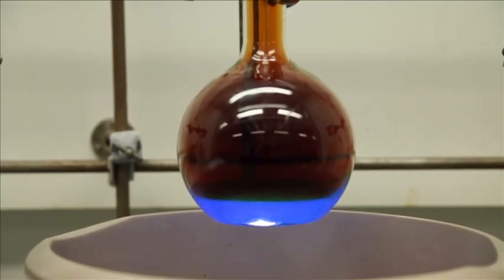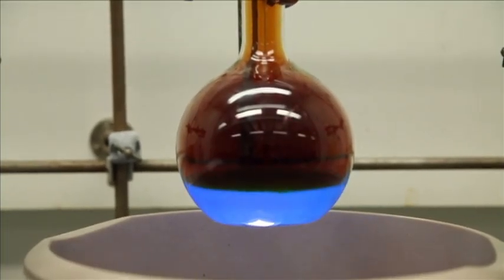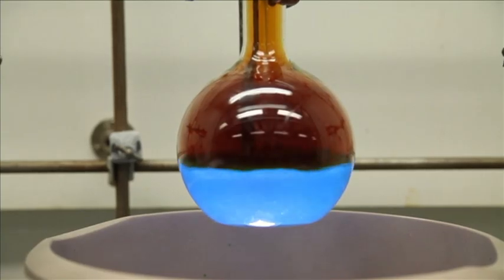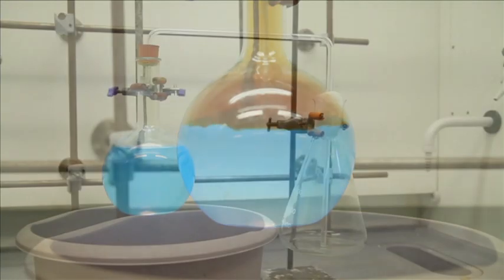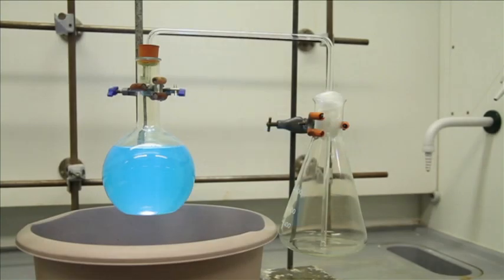When the water reaches the reaction flask, the NO2 dissolves in and reacts with the water, and the pressure drops still further, leading to a fountain effect. The colour goes from a greenish colour to a blue one as the incoming water ligates the copper ions.